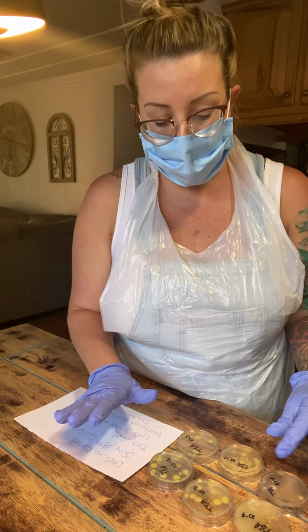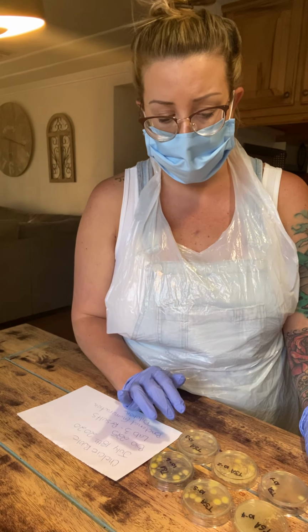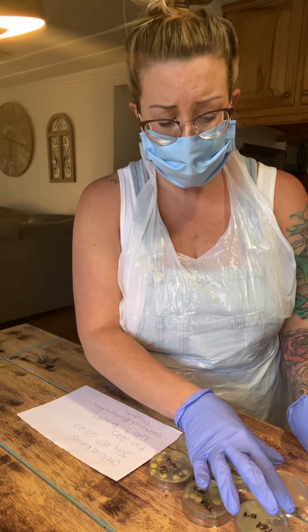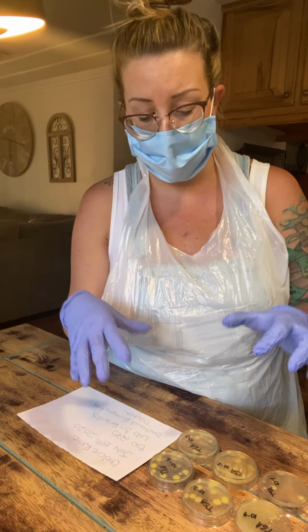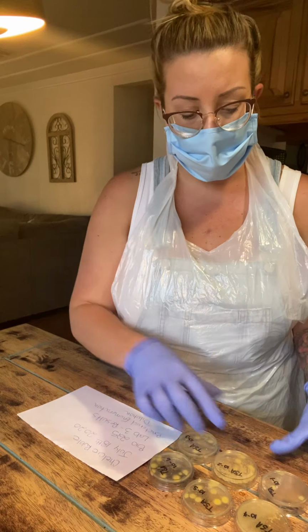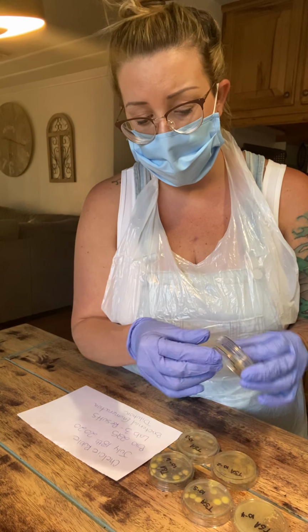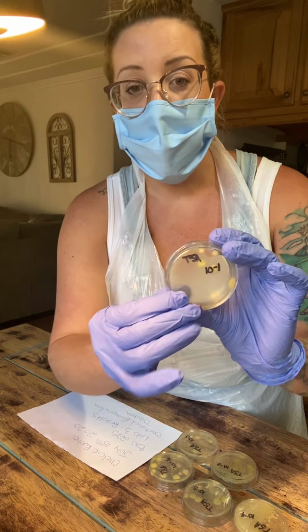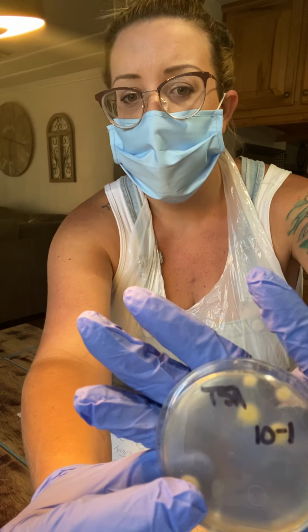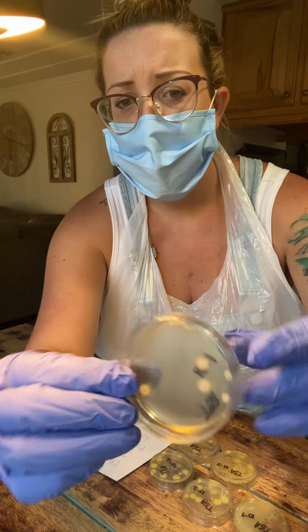When I'm looking at the overall result from my experiment, they're kind of inconsistent. In the end, I will show a better close-up of my results, but just to give you a quick understanding, this is going to be my result for number 1, which wasn't really diluted, and there aren't many colonies.